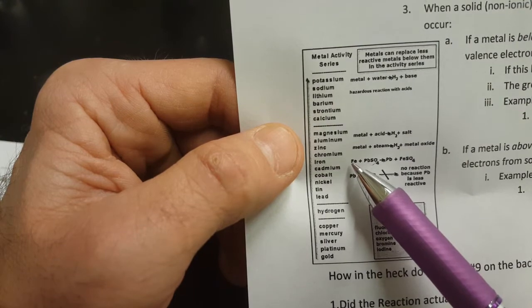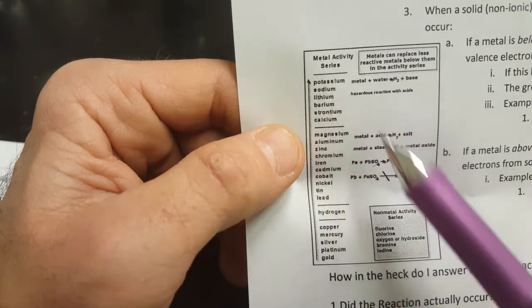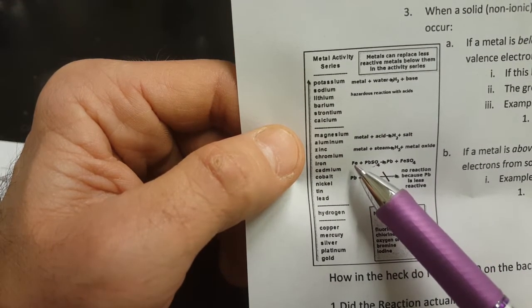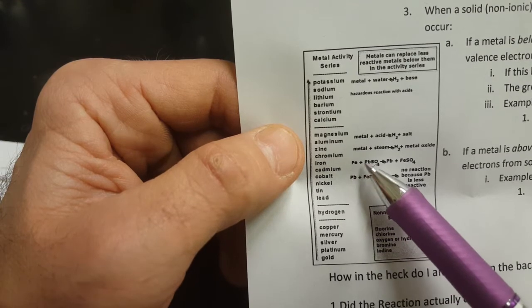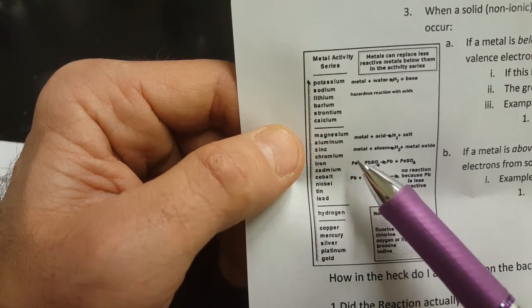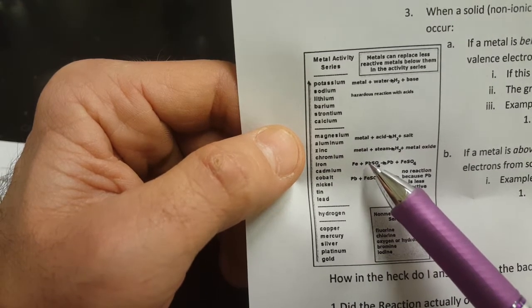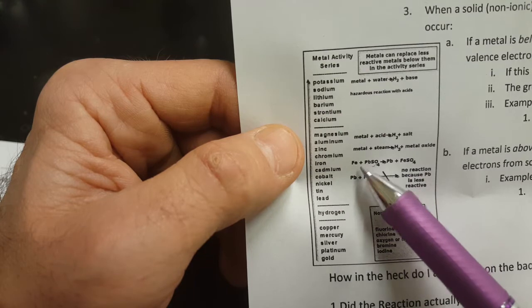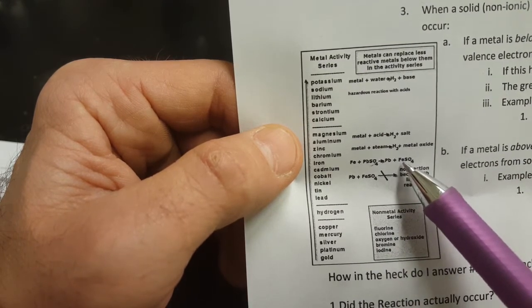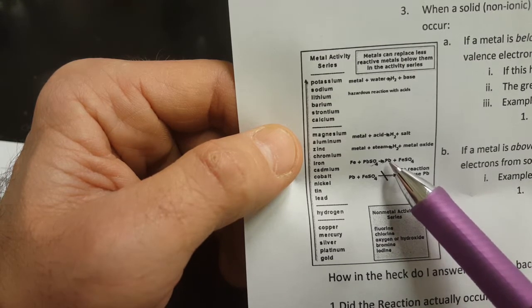Now, if you lose electrons to somebody, that puts you higher on the list than that other element, right? So that makes you more reactive. If you lose electrons in a fight with another element, then that makes you more reactive than that element. In this case, this plus charged lead stole electrons from neutral iron. Now look, the iron dissolved into solution and we'll get solid lead back.